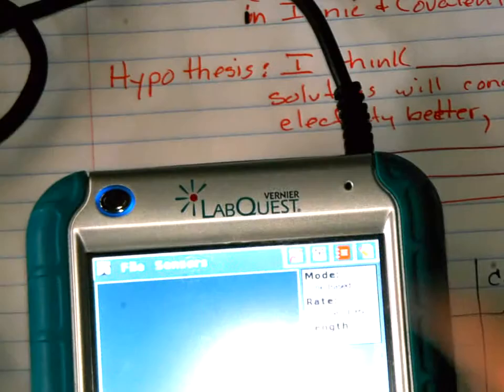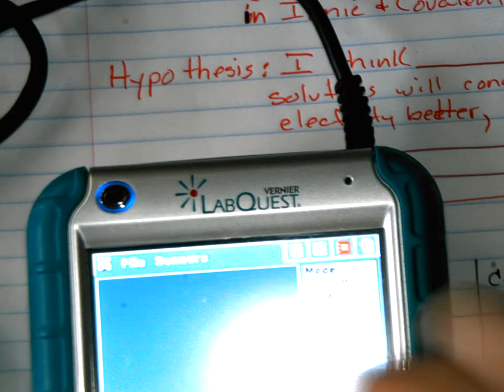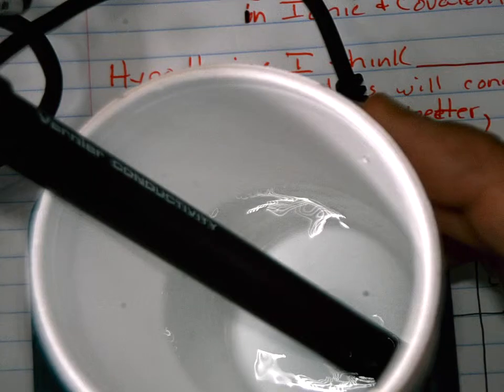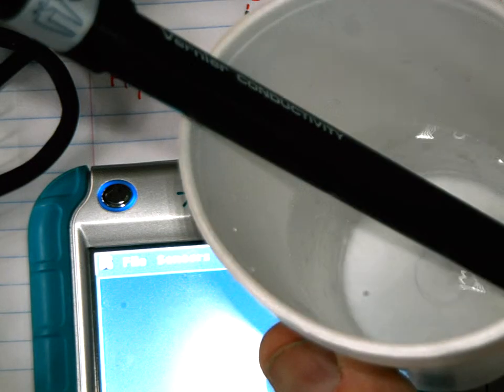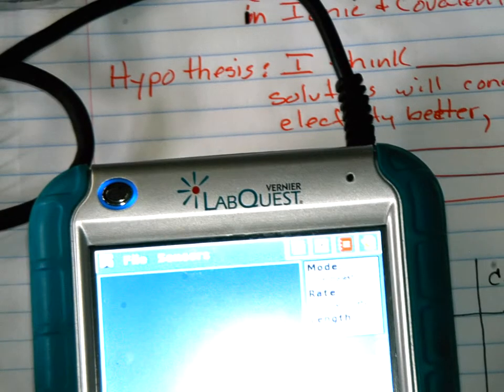Sensors. Come on, work here. Why are you not working with me? Pushing sensors, it should pop up. Let me see if I put it in water, does it pop up with a number for us? You're going to have to gently stir this around. Okay, I got an idea. Go get your probes right now. Get them plugged in, and hopefully you'll have better success than I have with this one.